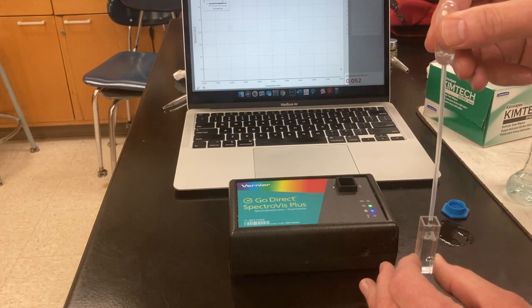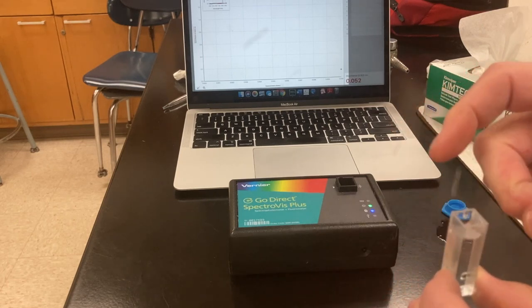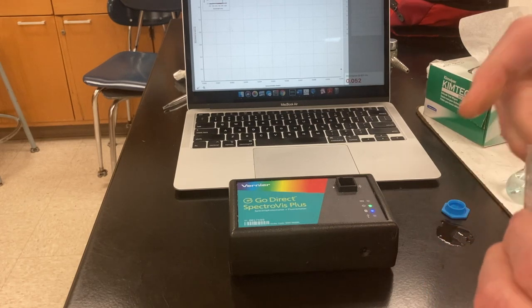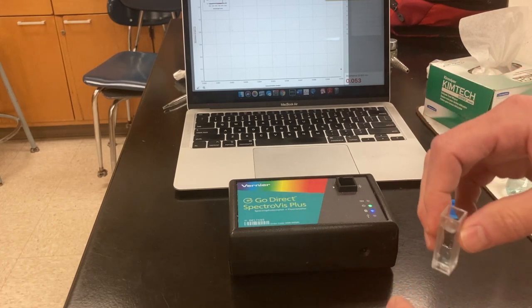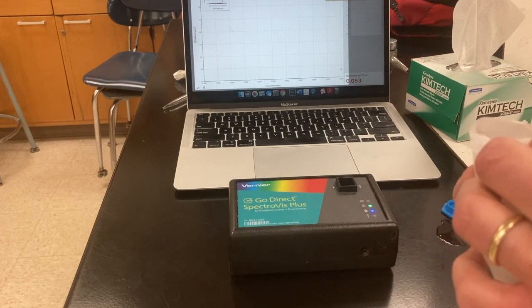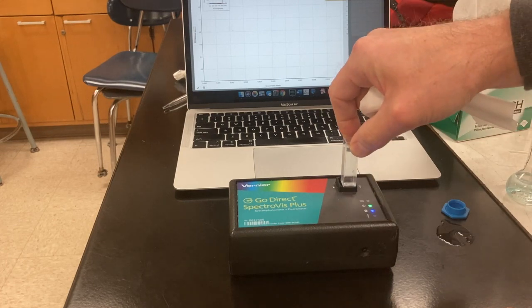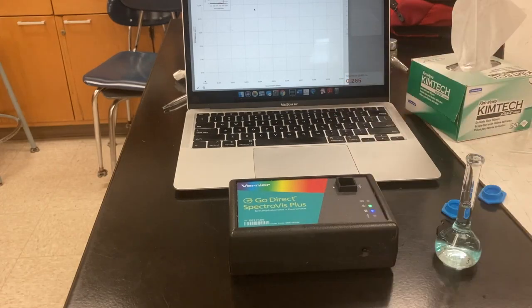So now after these 2 rinses, I'm ready to fill this up with solution from sample 2. Got some bubbles in there, so I'm snapping the side of the cuvette to get them out. Wipe the droplets off the outside so that they don't distort the light as it passes through. And then I'll take another reading. So I'm going to do that for the remaining 2 samples. You've already seen how it's done, so we're going to speed through this.